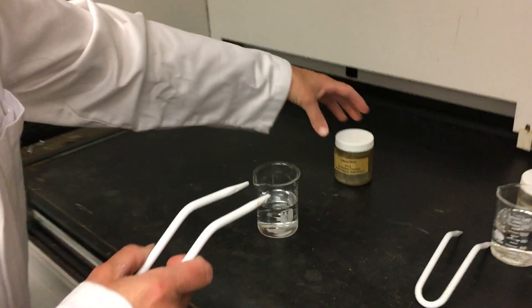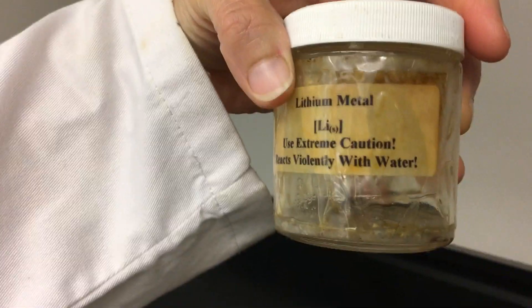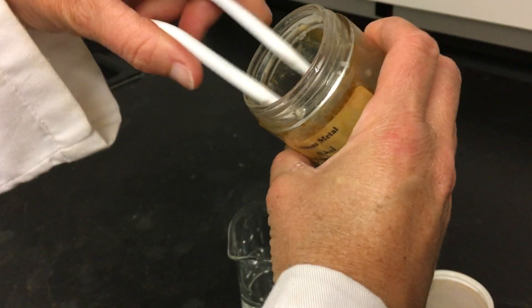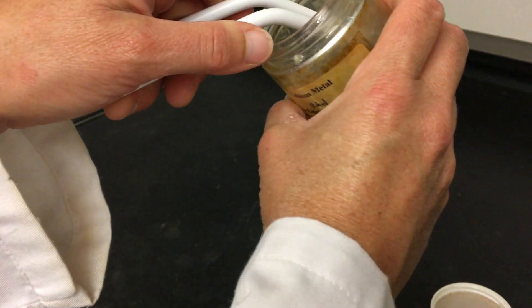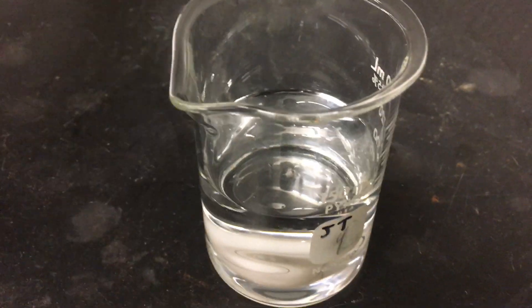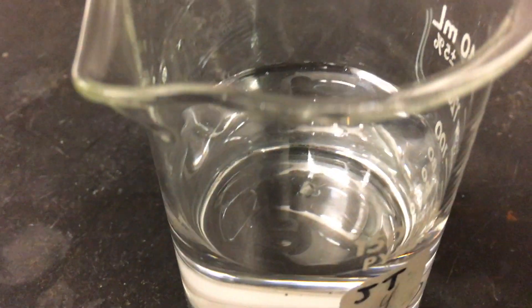The first one that we're going to test is lithium. Lithium is stored in oil, which it doesn't react with. So I'm going to take out a piece and we'll add it to our water and observe what happens. As the oil comes off, we should start to see lithium being able to react with the water.